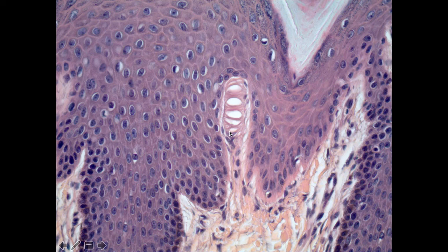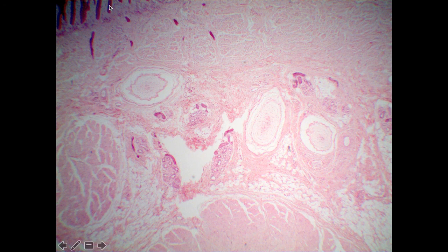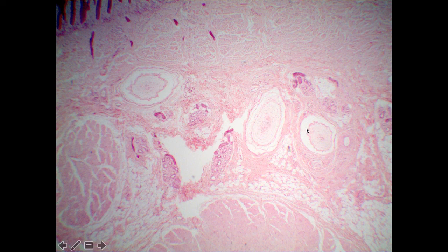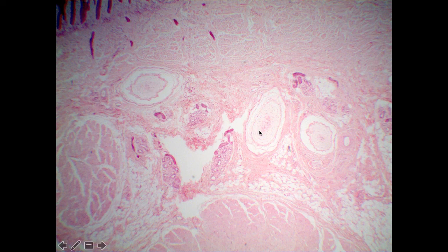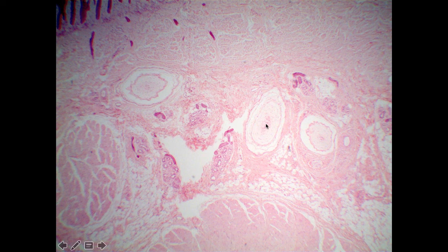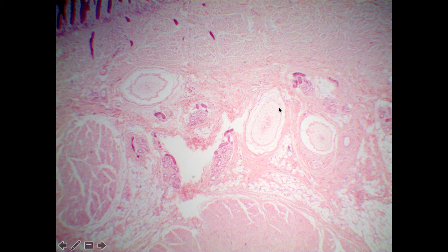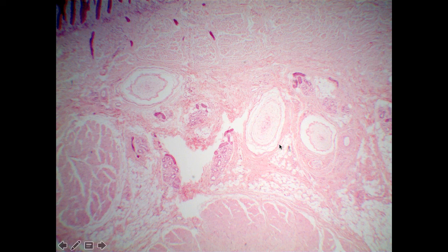The other type of sensory receptor you're expected to identify in histology slides is present in this field of view. With the epidermis at the top, the papillary region of the dermis, and now the reticular layer — deep down in the dermis there are structures that almost look like sliced onions. These large onion-like structures are referred to as Pacinian corpuscles, and they are involved in deep touch. The fact that they are deep down in the dermis, as opposed to the tips of the papillary region where we found Meissner's corpuscles, suggests that they require much deeper pressure to activate them, extending down into the hypodermis.